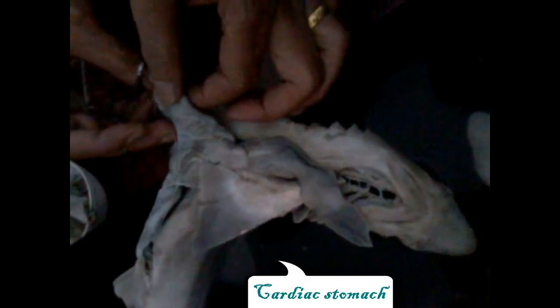See, this is the stomach. The stomach part has a blind sac here. This is a blind sac. So that demarcates the stomach as cardiac, and then here it is a pyloric stomach, short. And then as it goes further, you can call it the ileum. And the enlarged part of the ileum is known as the valvular ileum.